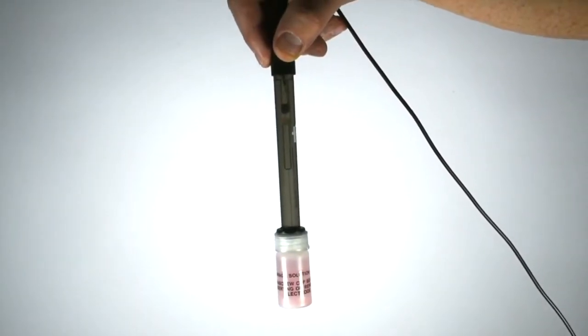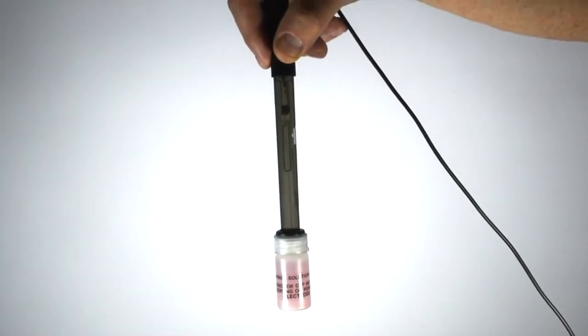After cleaning, let the electrode soak in its storage solution for at least half an hour.